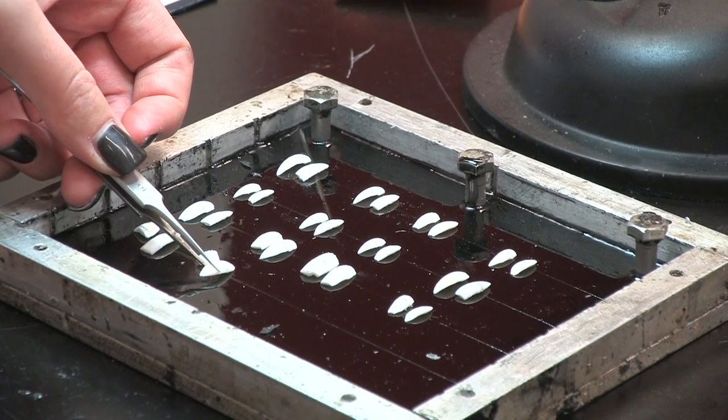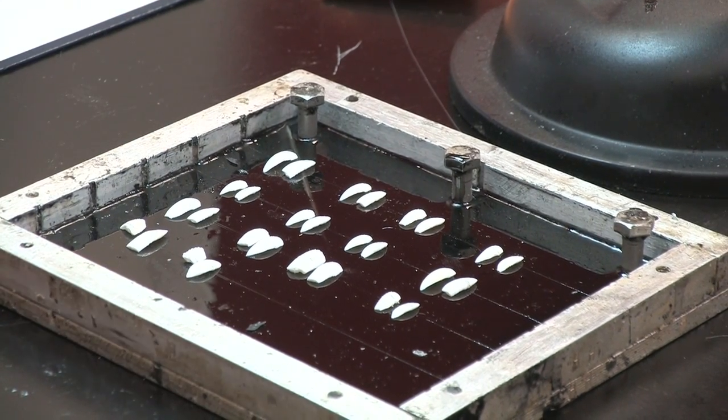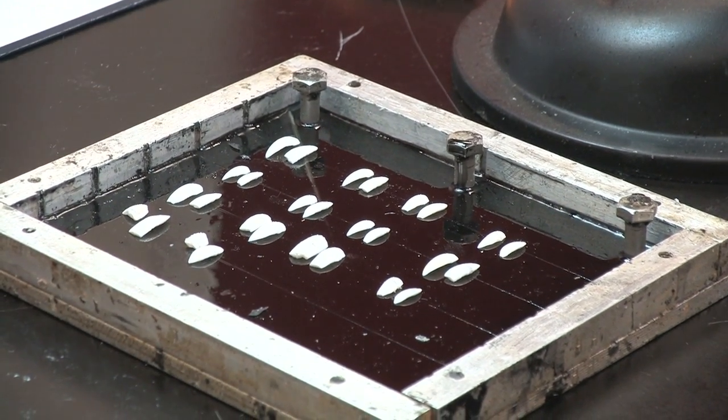If you are working with numerous otoliths you can certainly embed them closer together than what we have shown here.